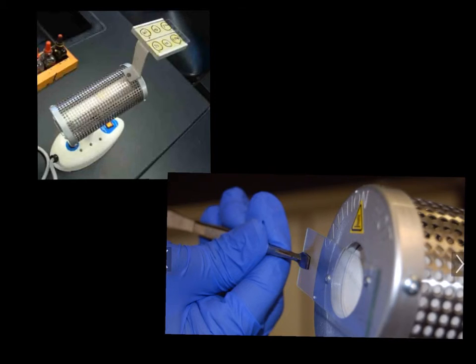Now if we have a bacteria incinerator, we can have a special connection where we set our bacteria slides on that slide rest there and we can heat fix it, or we can hold it over the opening section of that incinerator.